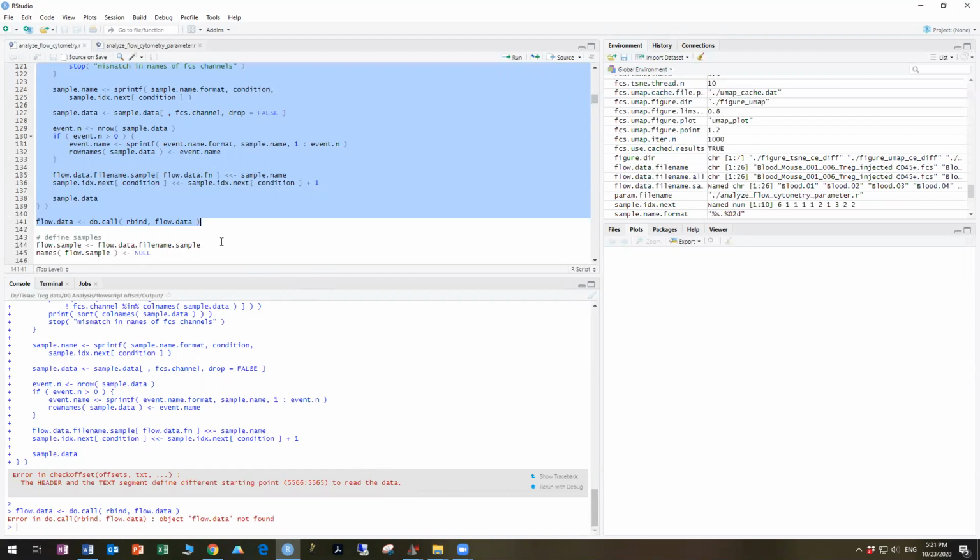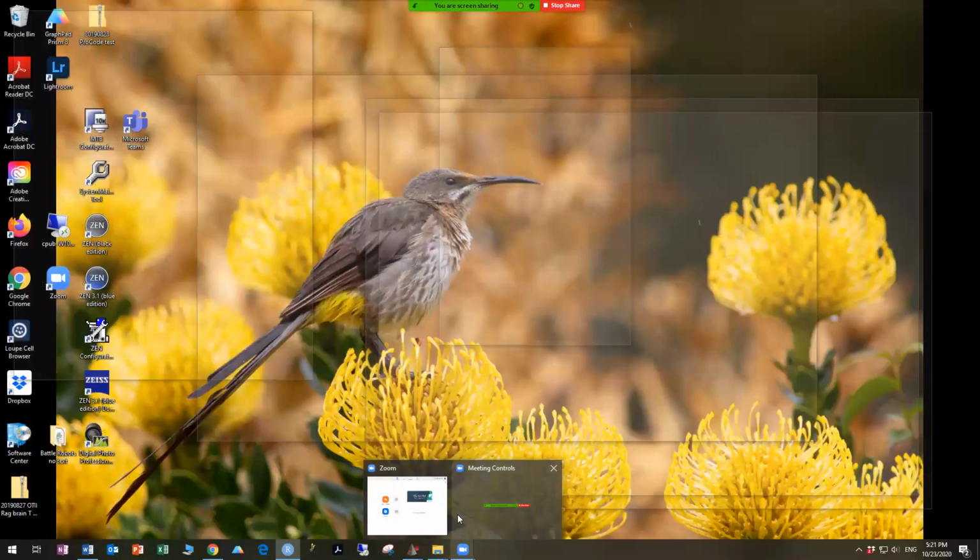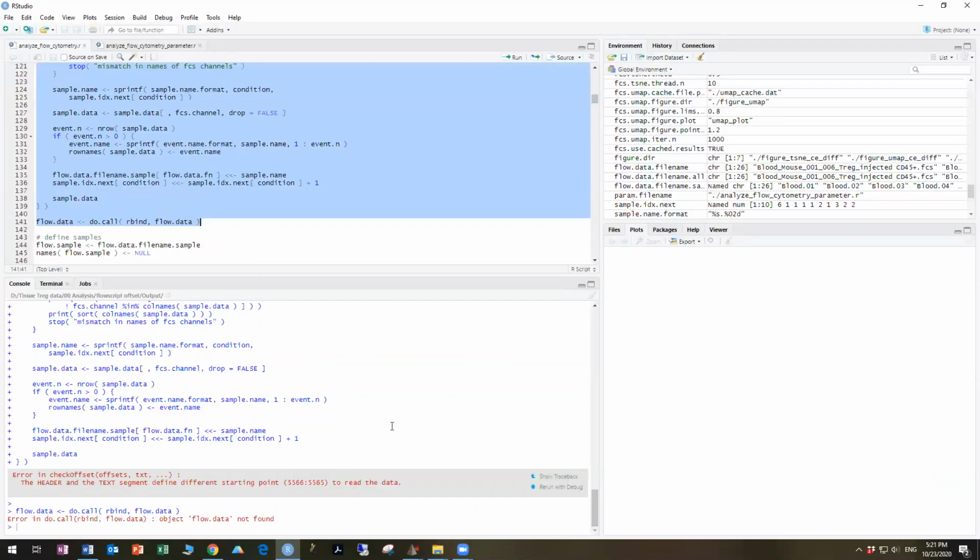You can go back and re-export that particular data file as a new FCS file. Frequently that will solve the problem. It frequently occurs if FlowJo is being taxed heavily because you're analyzing large amounts of data. If you have hundreds of data files, you typically can get away with excluding one file. And so what you can do in this case is we're just going to move it into a new folder.